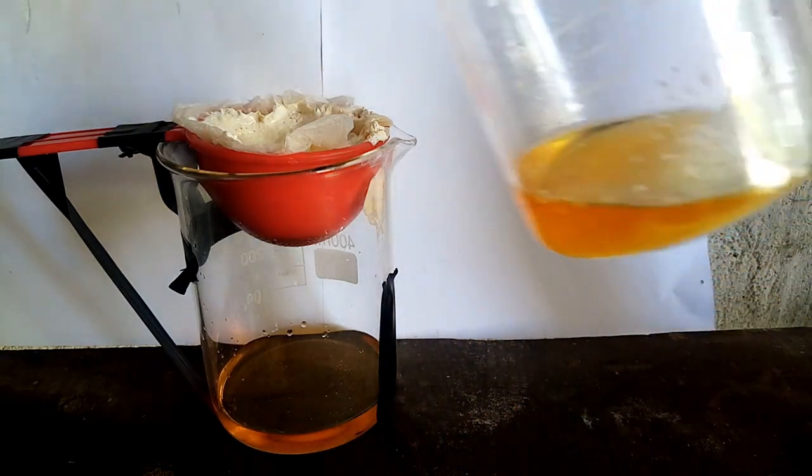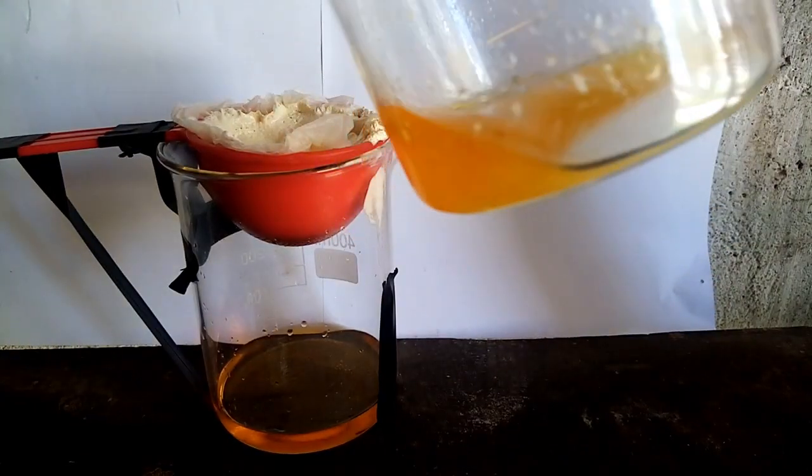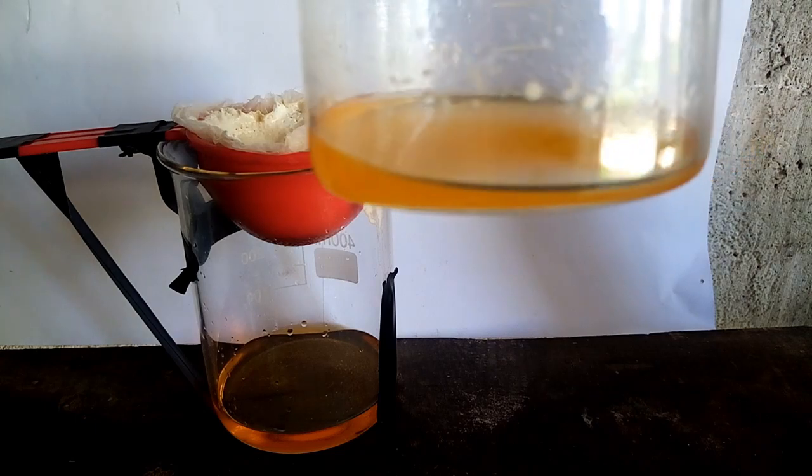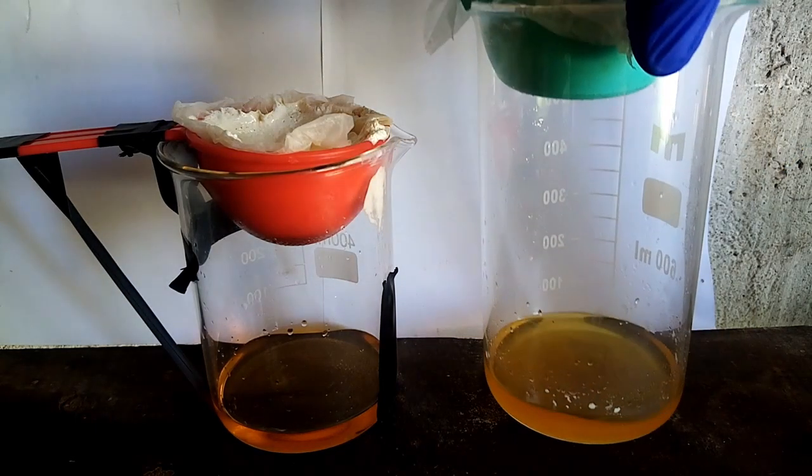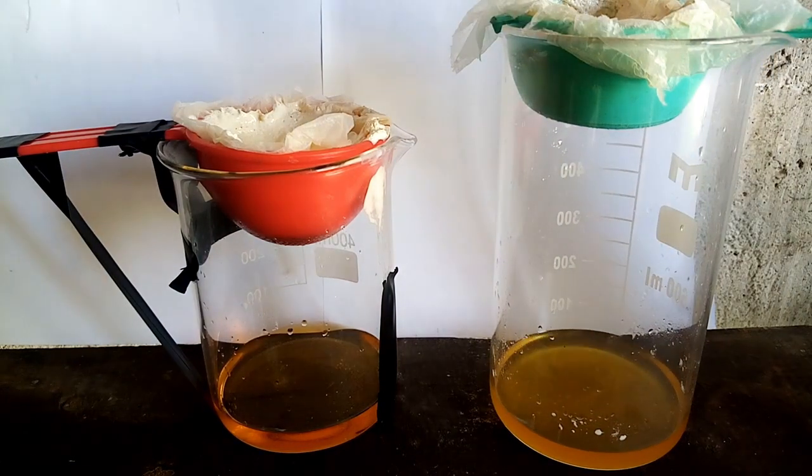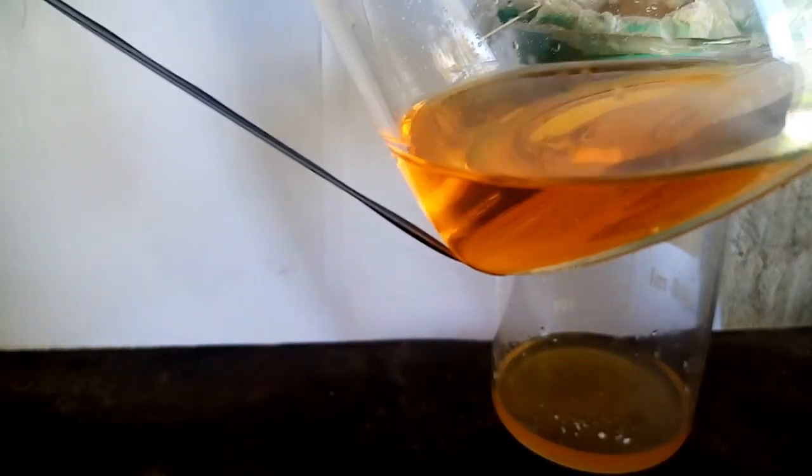After I let it sit for a day to filter it off, I was left with a really great yield of nitric acid. For the next step I will need to filter it more to purify it.